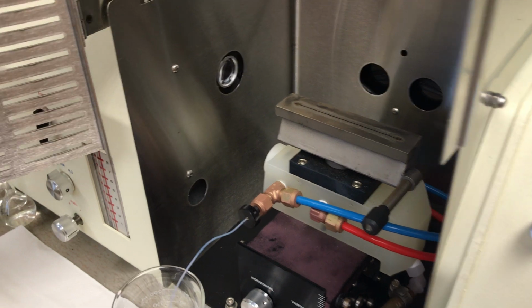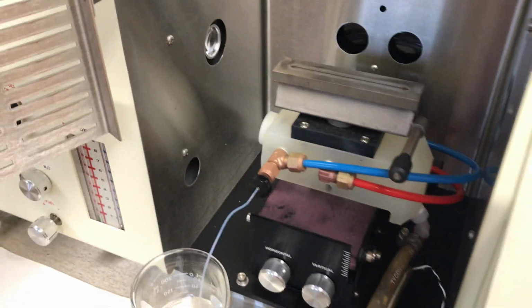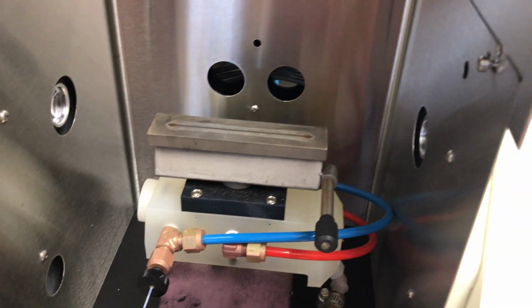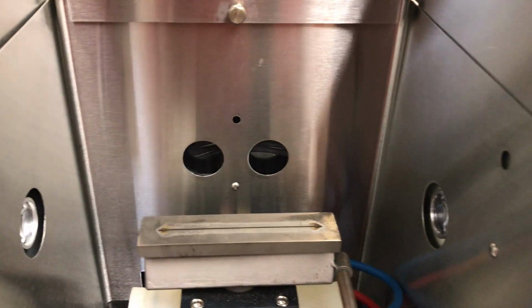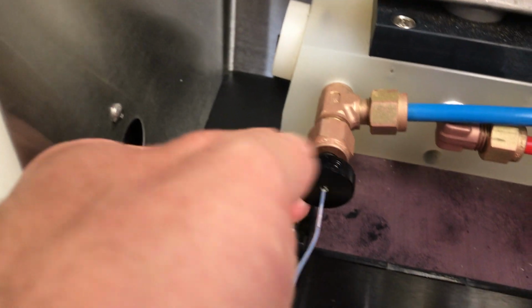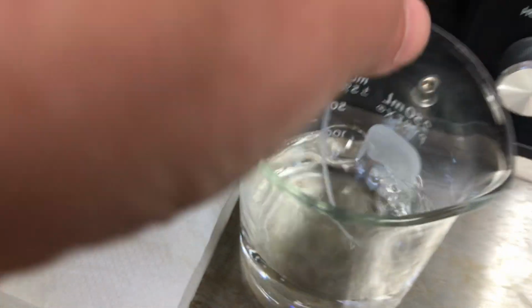Now, the next thing that I need to do is optimize the flow of the mist on the nebulizer, as I just showed you. So what we want to do again is show that we can get the best mist through here that we possibly can. So to do this, I'm going to turn the air back on, and now I'm going to take the adjustment valve here, and this actually adjusts the airflow to the nebulizer. And I'm going to turn it counterclockwise until I actually have bubbles coming back through.